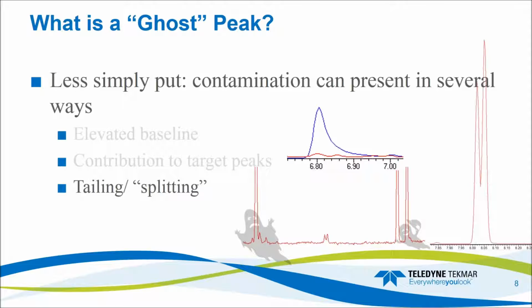And then last but not least, tailing and splitting. So for instance, on the top one here, we see a nice big peak with a long, broad tail. But if we look at a different ion, we see that there's actually a couple compounds in here. And then similarly, with these in the lower chromatogram, we have these little splits before and after, or we have this little hump here on our tail. And do we include those in the integration, or do we not? Do these little splits, do they occur with every sample? If they don't occur in all cases, and you choose to include them, maybe that skews your results. Maybe you need to include them when they occur, and you don't when they don't.